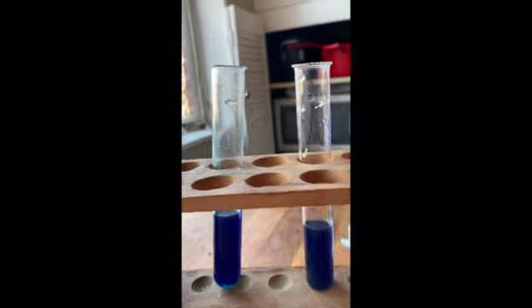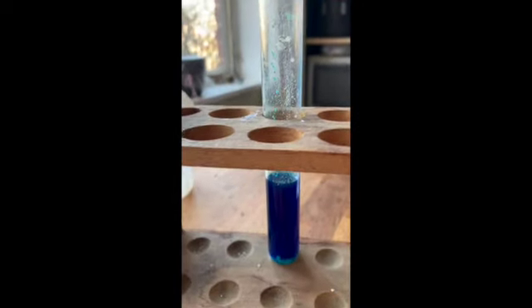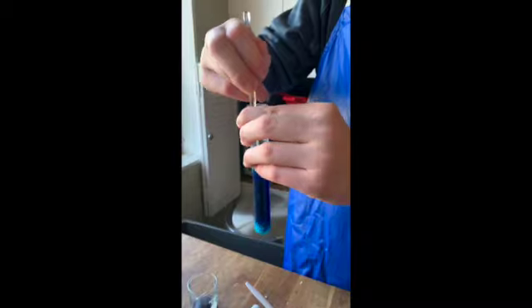Just adding a little bit more to make this go faster. Maurice has been stirring now for a couple of minutes. Now put the two next to each other so we can compare color. You can definitely see that our test tube with the calcium chloride added is definitely a brighter blue color and it's not quite as purple.